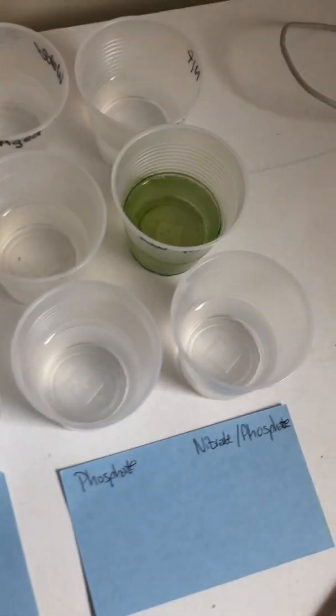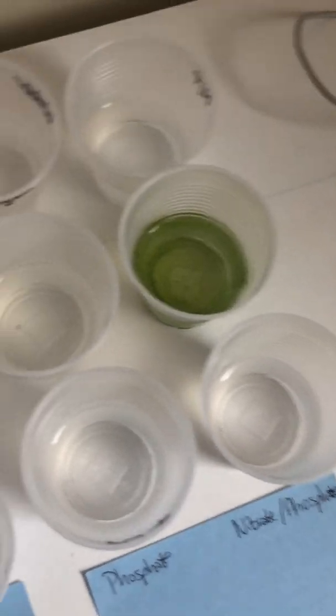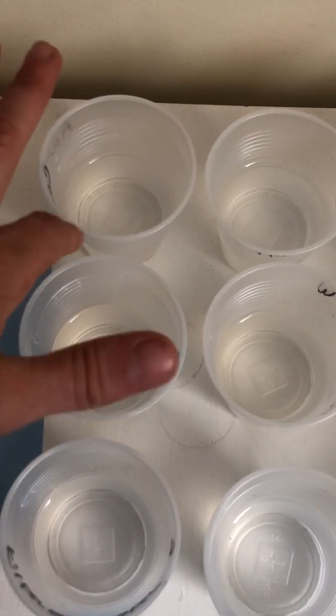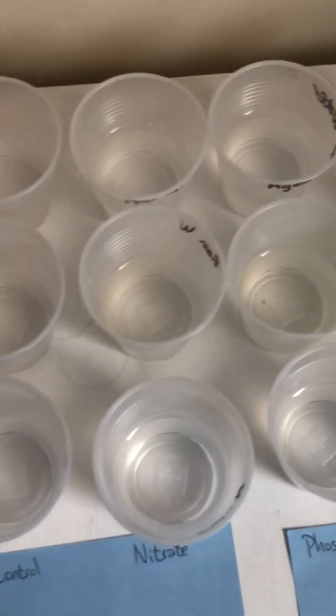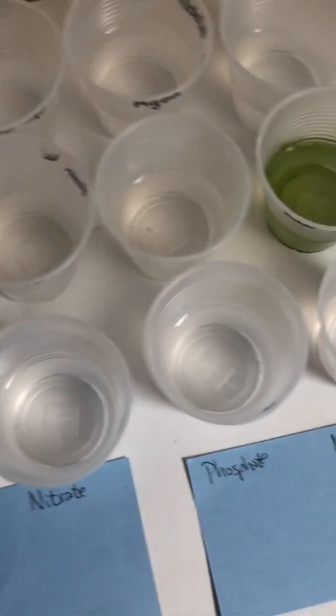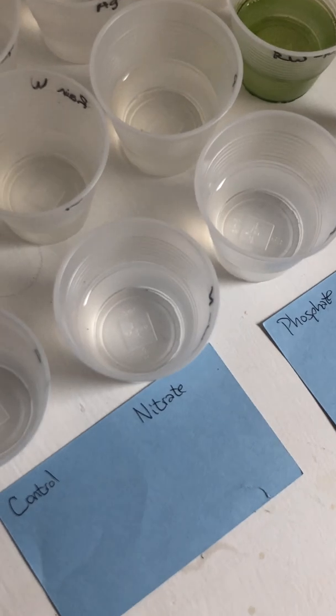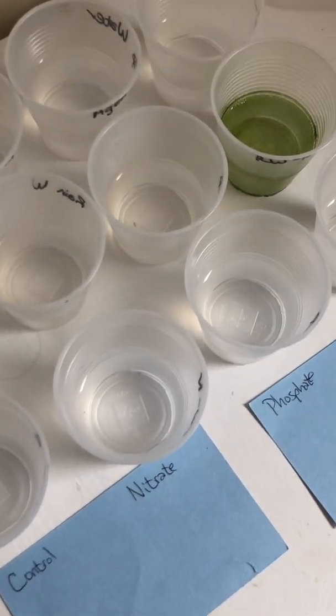The presence of these microbiological organisms often causes this algal growth. They would be filtered out in our tap water and our filtered water, but not in the rainwater, because the rainwater is a natural source. So the presence of this bacteria naturally is what's causing this growth.